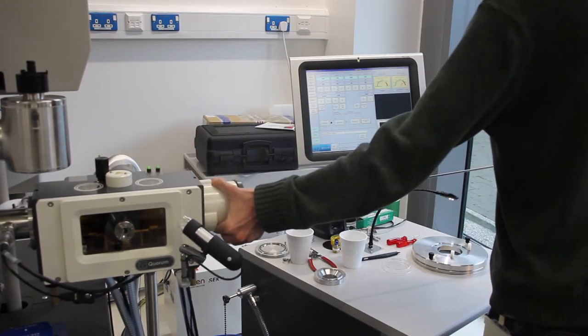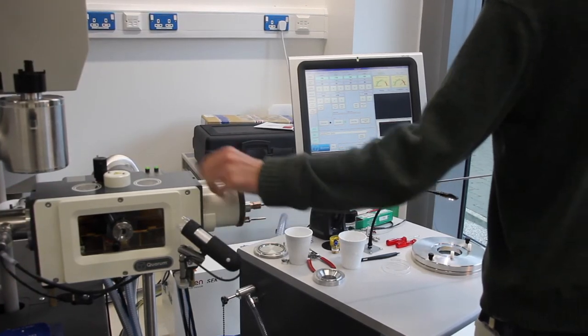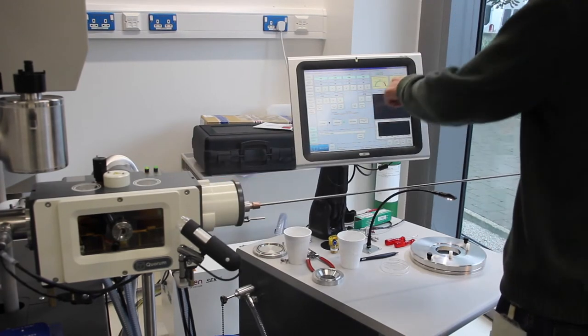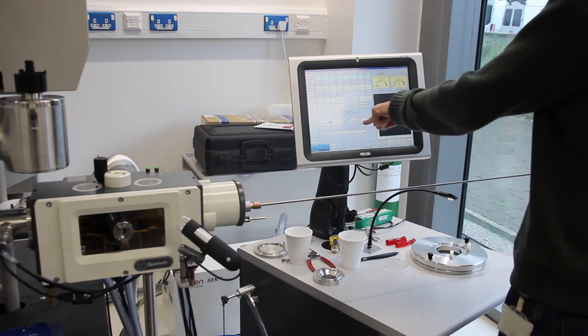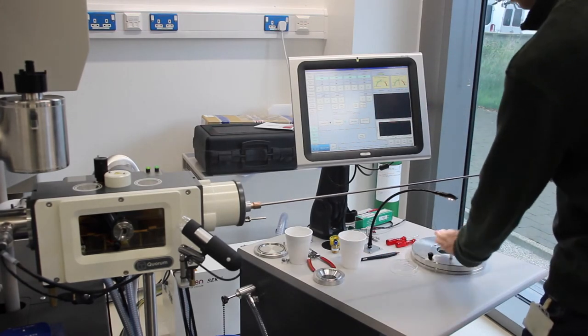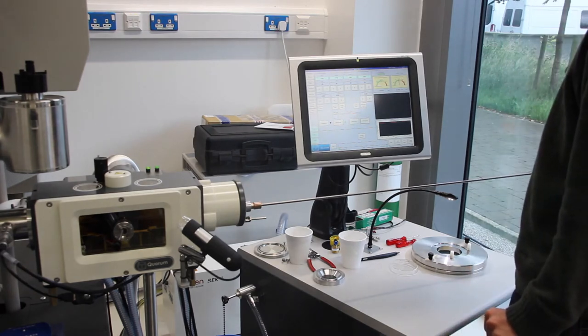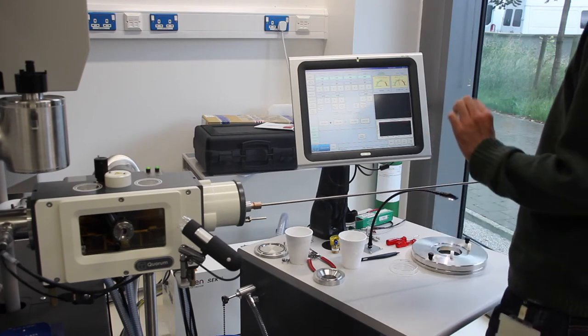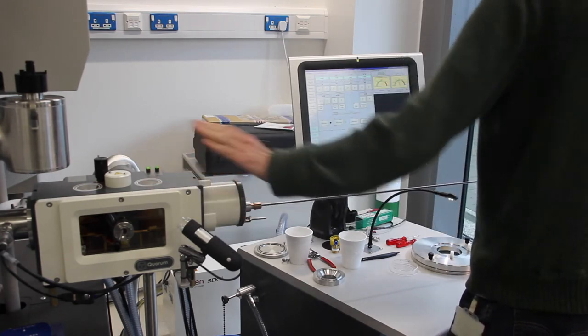Hold this transfer chamber flush. The light over here will indicate that it's pumping, and you can follow its progress over here. Also cancel the slush vent for this chamber over here. Once it's reached a sufficiently high vacuum in here, it will allow me to open this rod into the rest of the prep chamber.